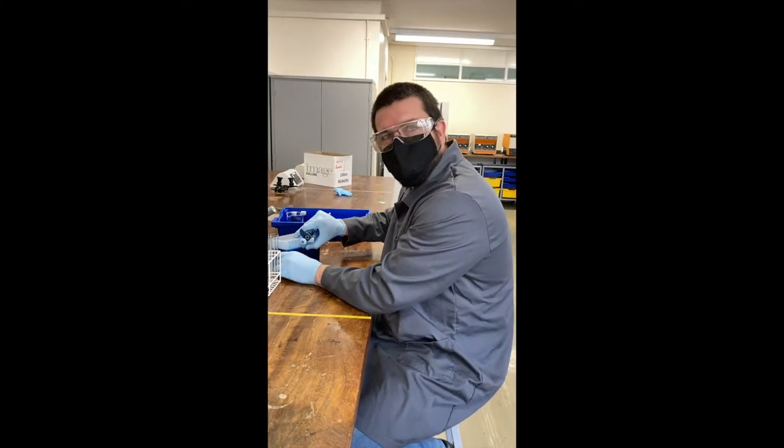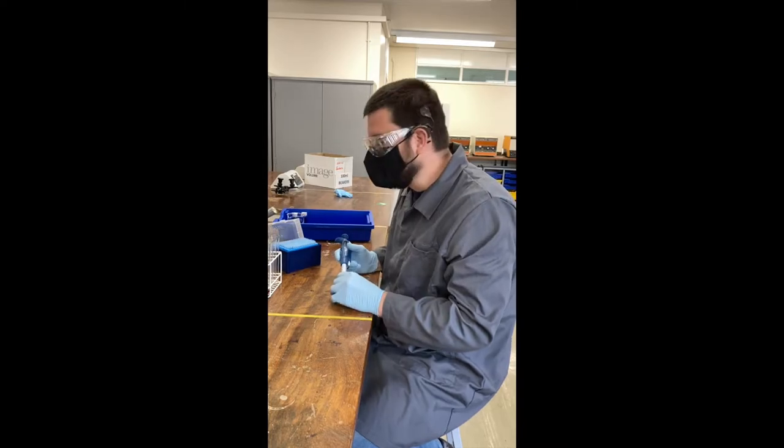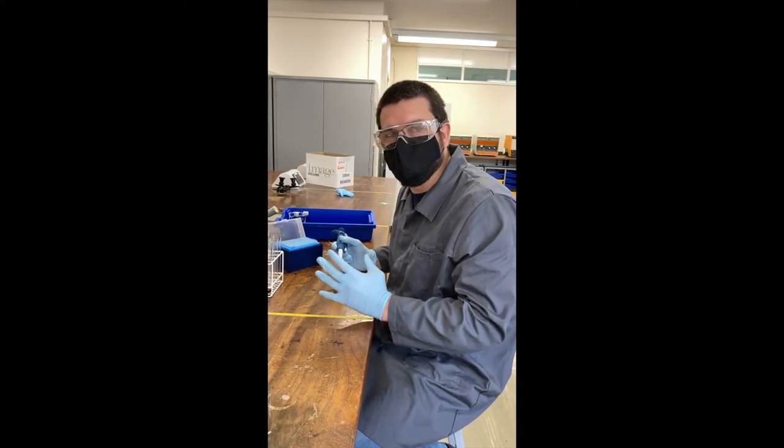Okay guys, what we're going to do today is show you how to create a standard curve. I'm going to show you two methods to do this. The first is a serial dilution.